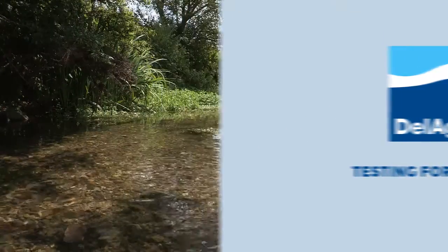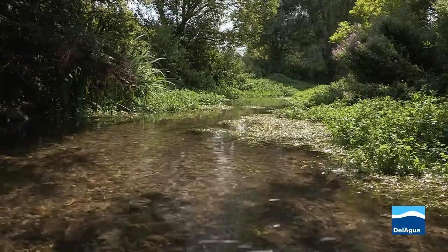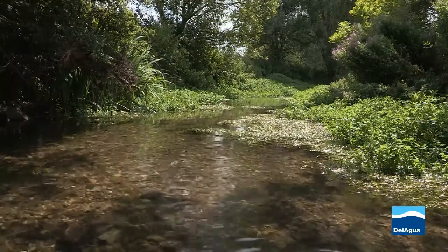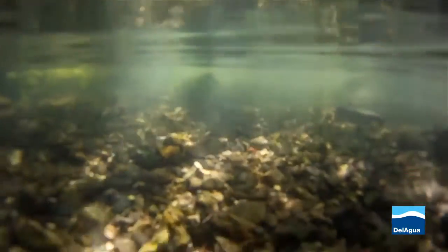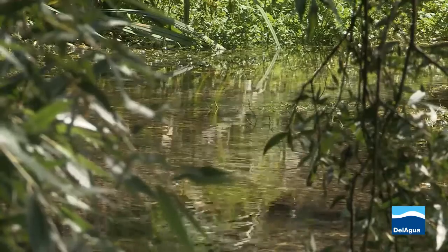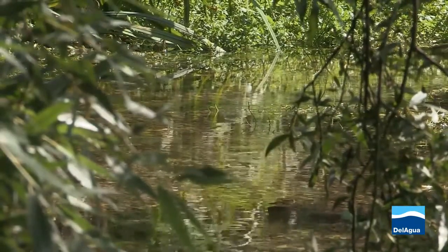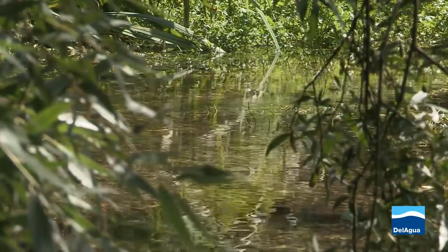One very common and simple test for water quality is turbidity. Turbidity is the level of cloudiness in a water column as a result of large numbers of particles that individually would be invisible to the naked eye. These particles could be organic or inorganic in nature.